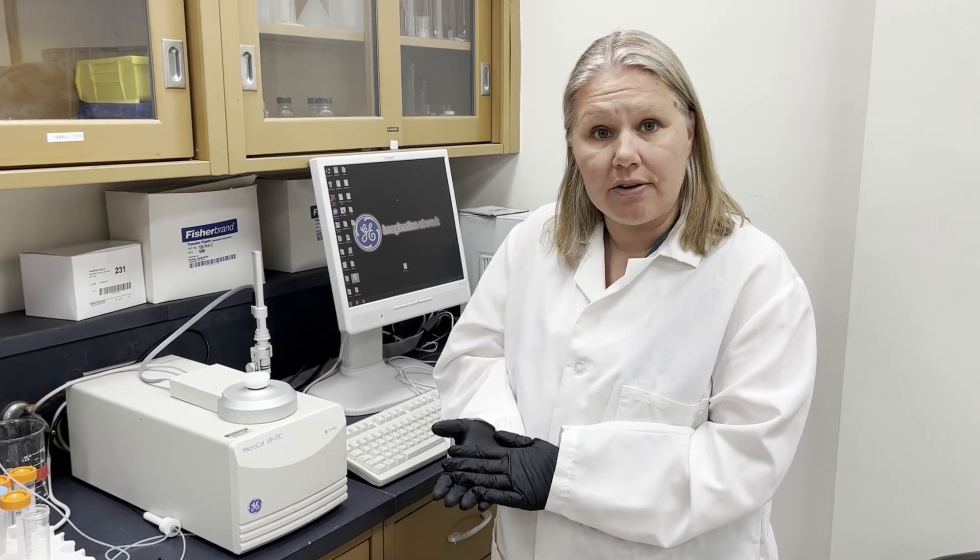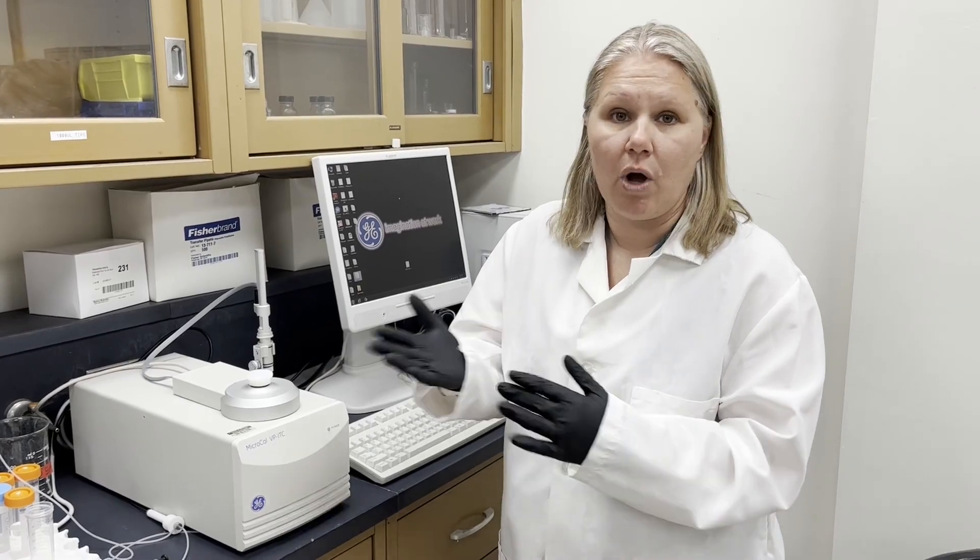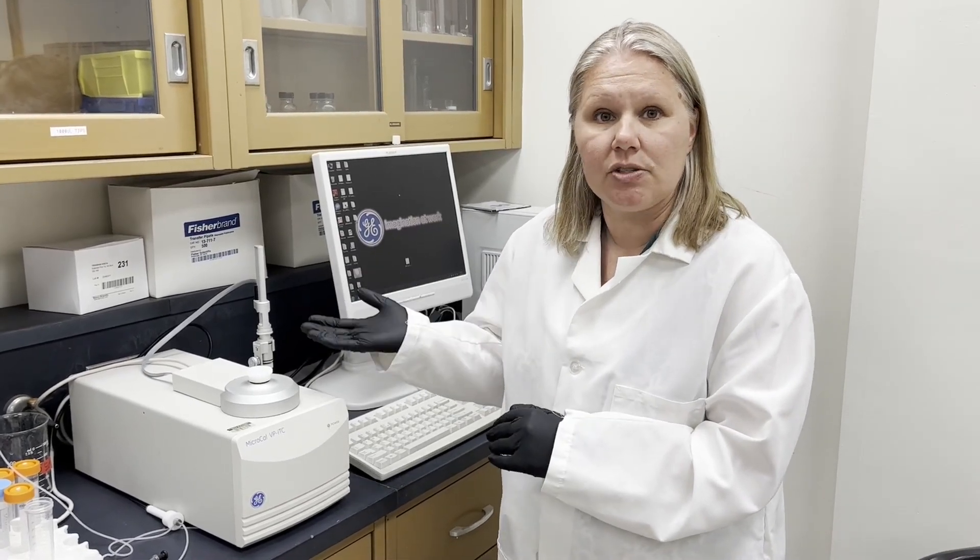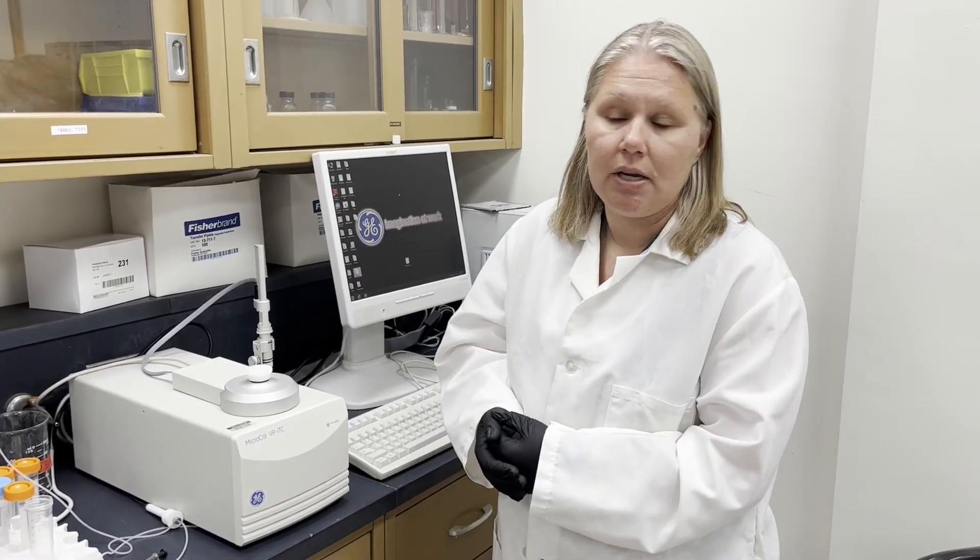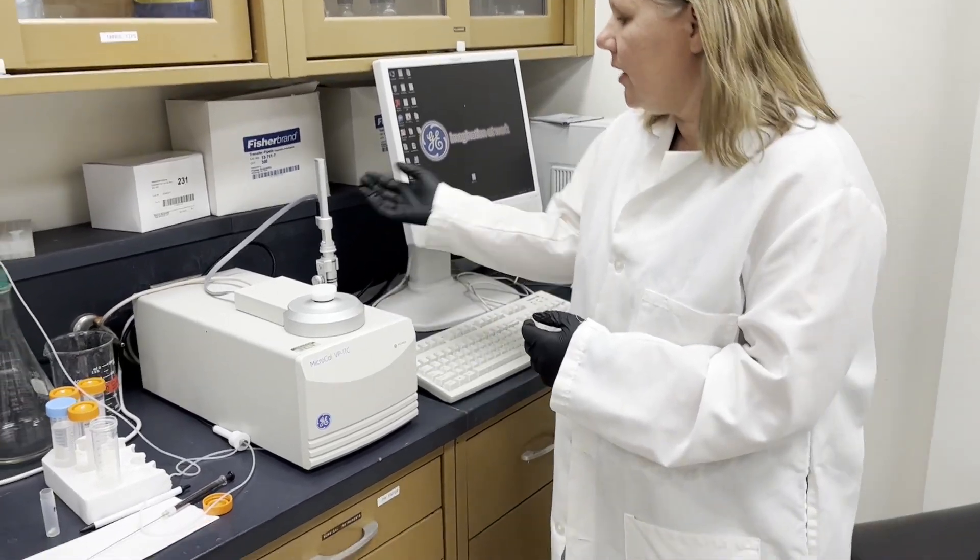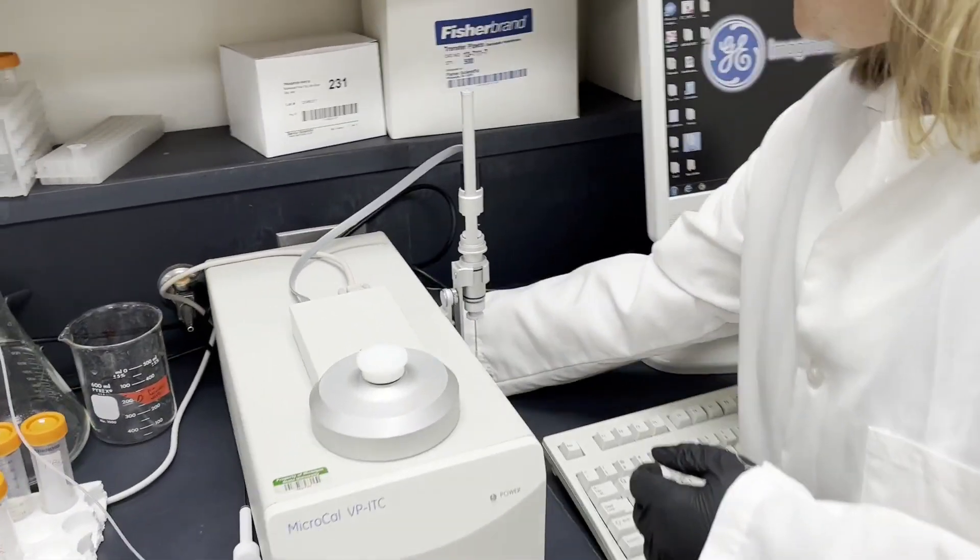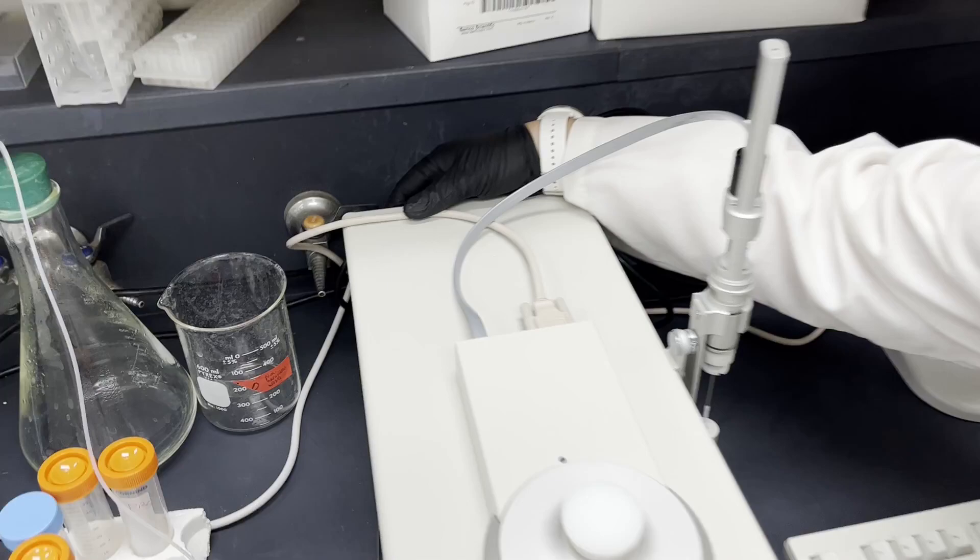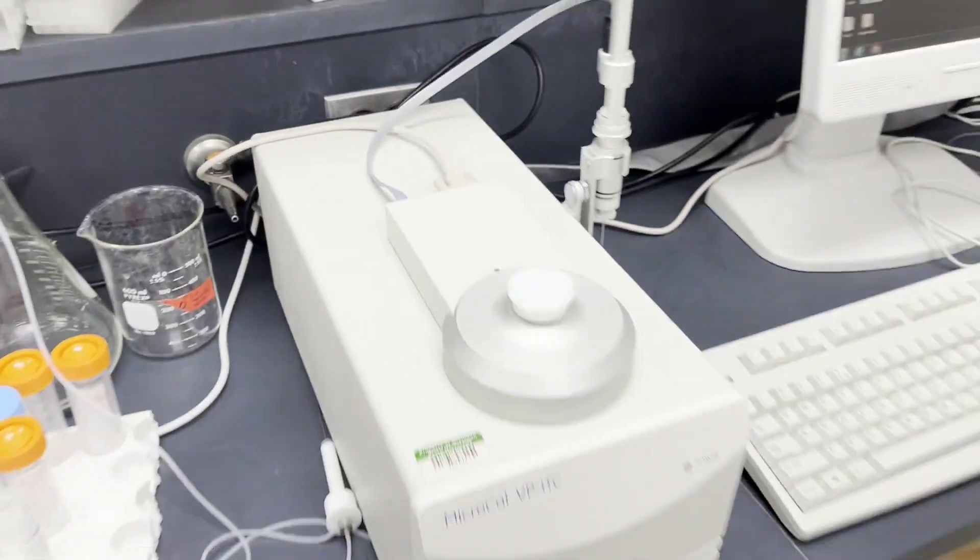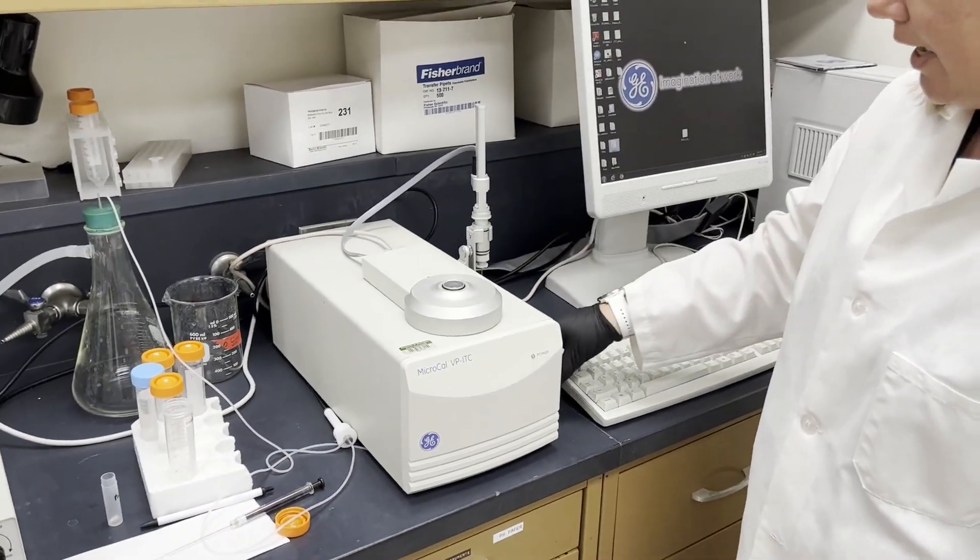Now I'm going to show you how to turn the instrument on, rinse everything out, and actually what I'll be putting in is just a water sample in the syringe and in the cell. The cell is in here, and to turn the instrument on, here's the power switch back there. So we'll let it turn on.